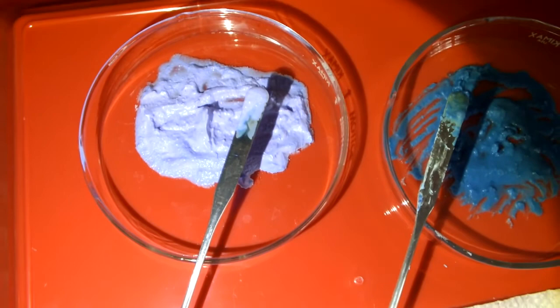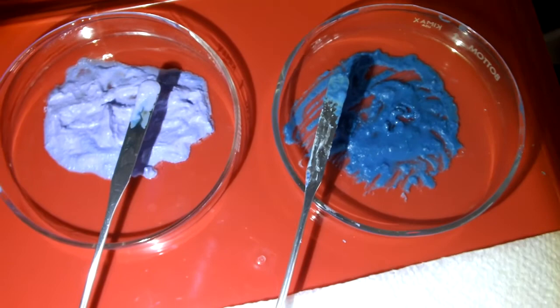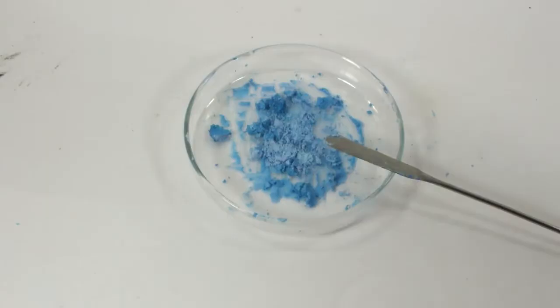Well, as they dry, there seems to be something amiss. The sulfate on the right is getting much darker, and the chloride on the left is turning blue in some parts. This could be a problem.